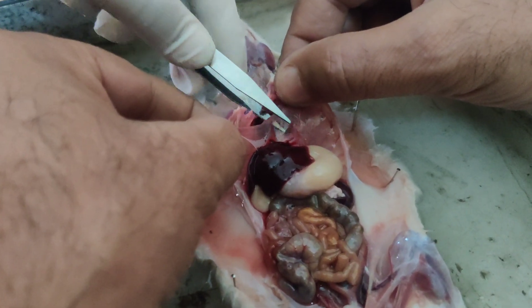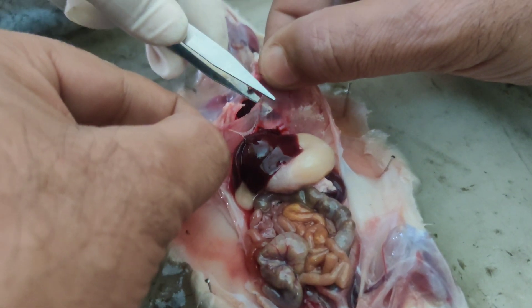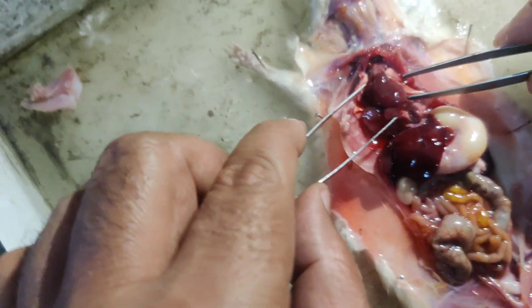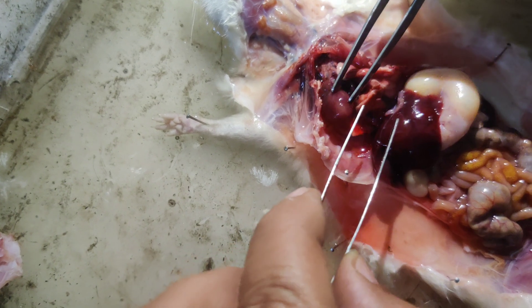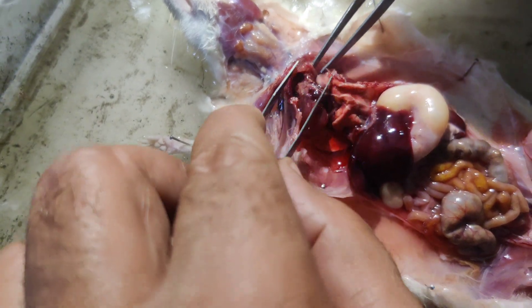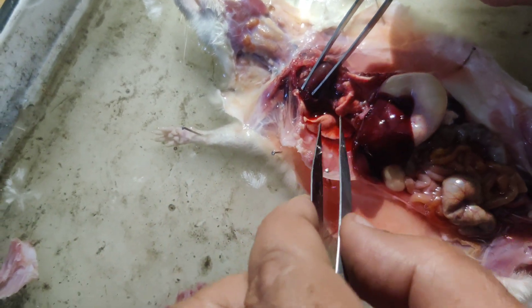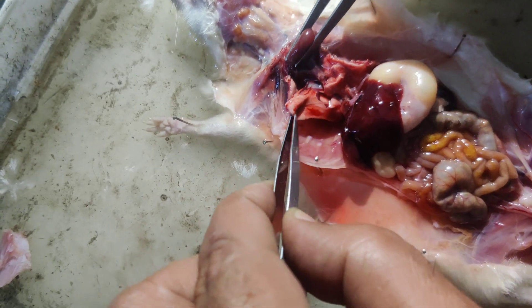This is the diaphragm, the partition between the chest and abdomen. Now opening the chest cavity — here you can see the heart. This is the heart. And this is the lung — this is the left lung and this is the right lung.